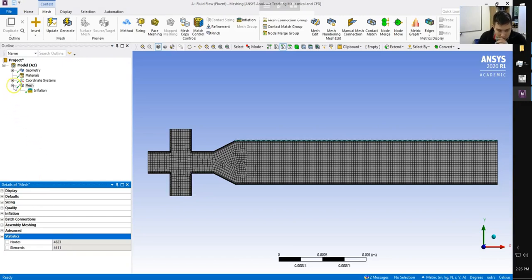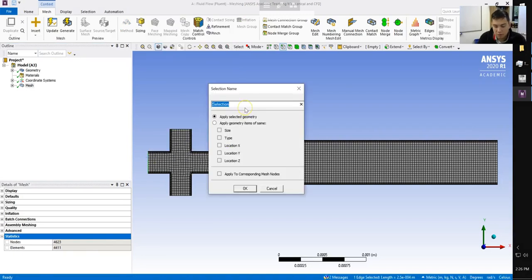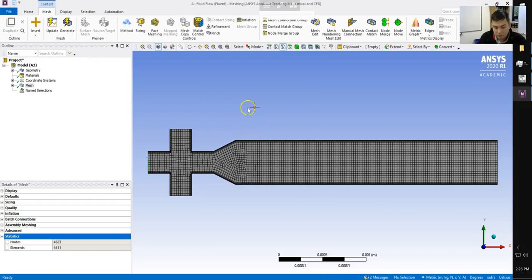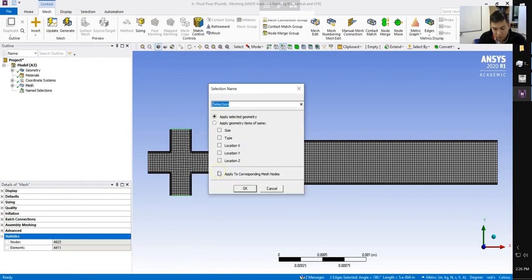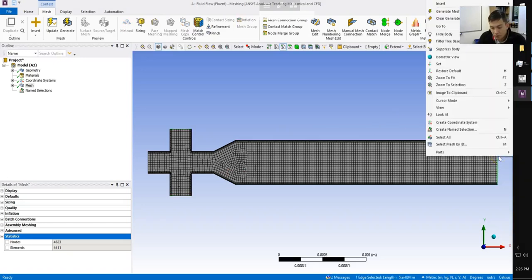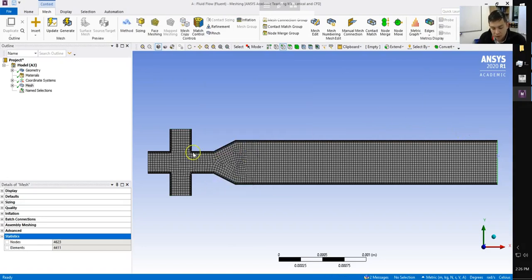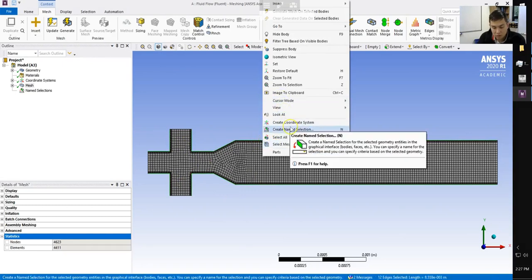Okay, the final thing we want to do here is go ahead and name our boundaries. So we can go ahead and right-click on our inlet on the left. So we're going to do Create Name Selection. This is going to be our oil inlet. Our top and bottom boundaries are going to be our water inlet. Our right boundary is going to be our outlet. And then the 12 walls where we've added an inflation will just simply be our walls.